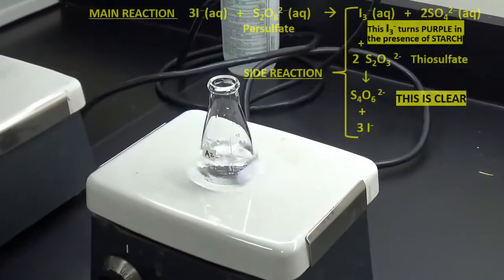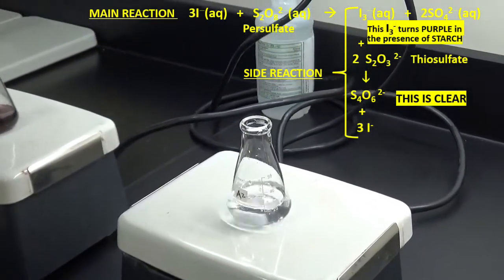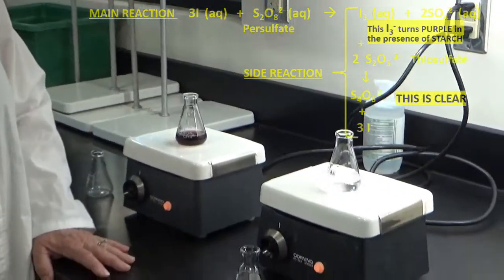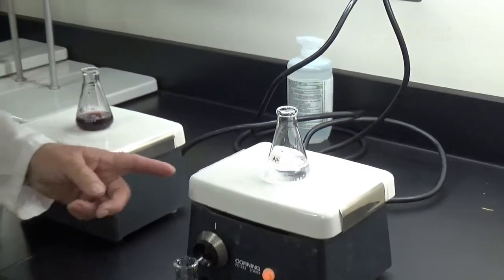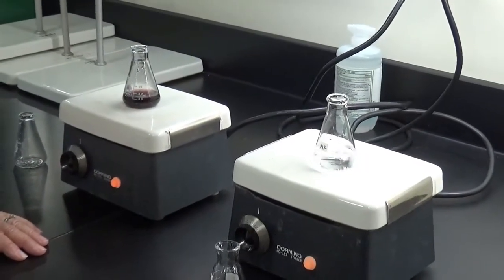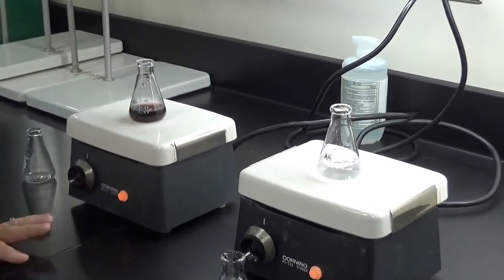I think you'll notice that there's no gradual change here. So let's see how long it takes to actually turn purple and to produce that iodine so that it's going to react with the starch. Now I can actually time this. This one would have been difficult to time, the first one. I think I added a little bit too much thiosulfate.